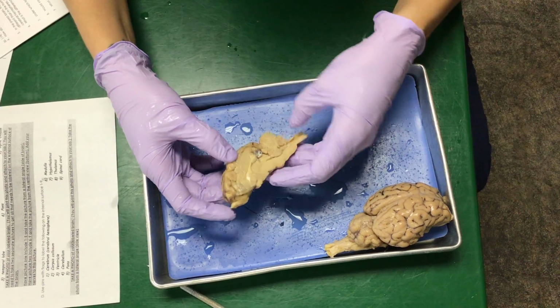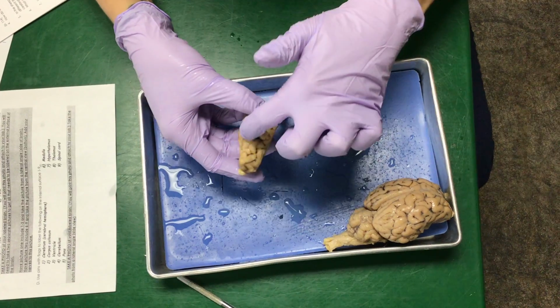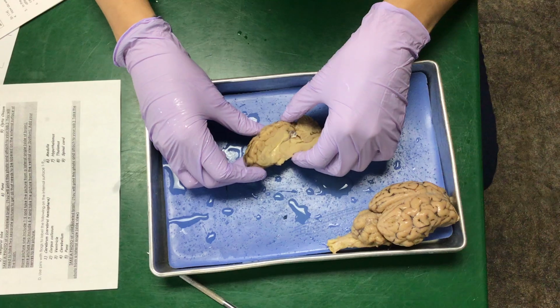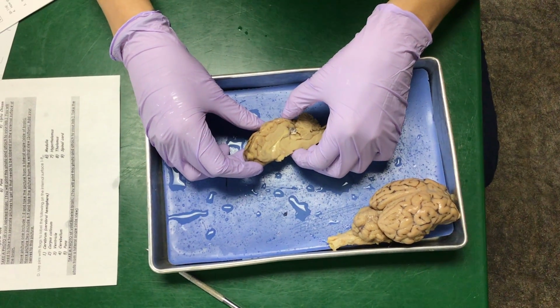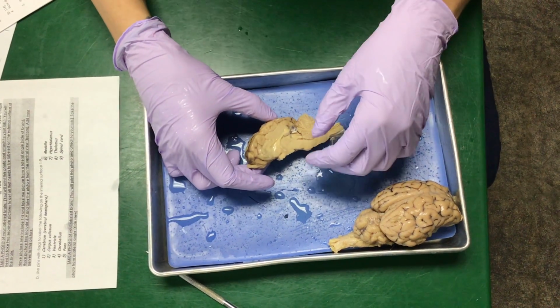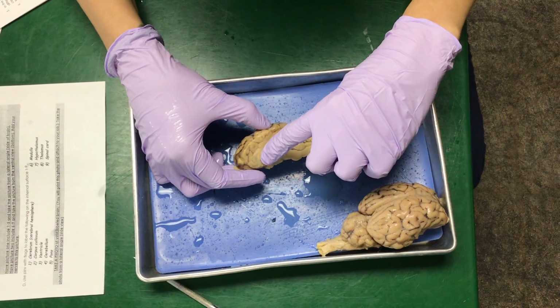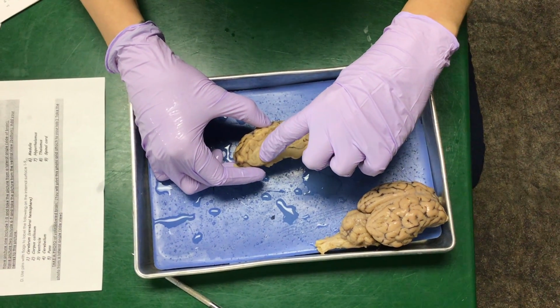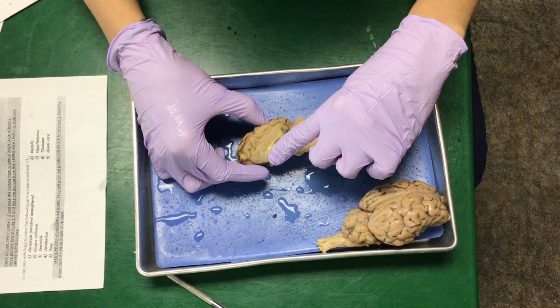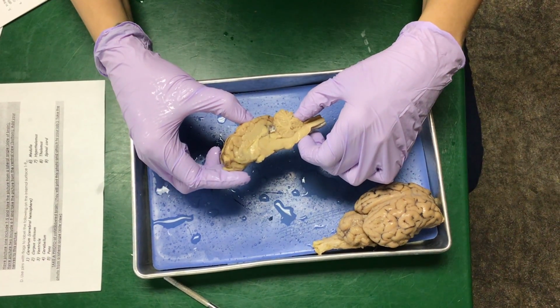Okay, the next one that I'm gonna give you is a half brain shot. So we cut these down that longitudinal fissure so we can see one half of this hemisphere of the brain. And now we're looking on the inside of the brain. The big things to point out, just giving you your bearings in order to label all the things that you have to on there, is that you can see this little white swoosh part. That's your corpus callosum. Underneath that, there's that hole. That's a ventricle.